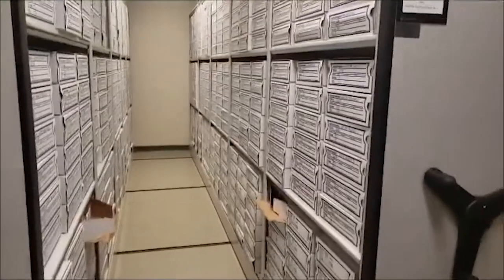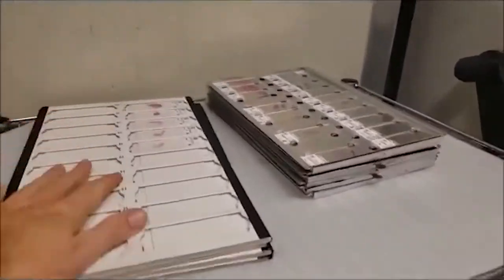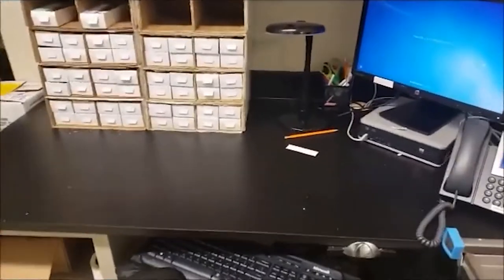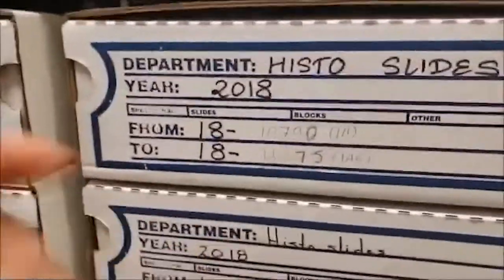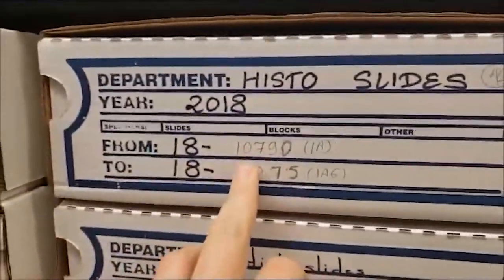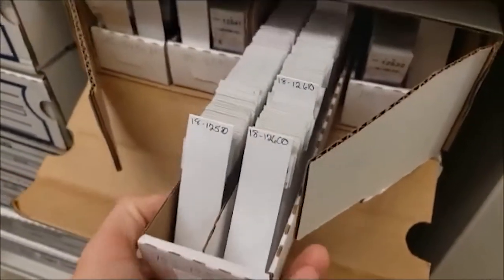We're going to start off today in the long-term storage room. This is where the slides were traditionally brought in on trays directly from the pathologists, taken to this desk, sorted into order, and then filed into cardboard boxes onto this high-density storage shelving area. Traditionally, boxes were all hand-labeled with the case number at the beginning and the case number at the end. Slides were manually sorted into what we call trays — long cardboard trays where the slides are all in numerical order.